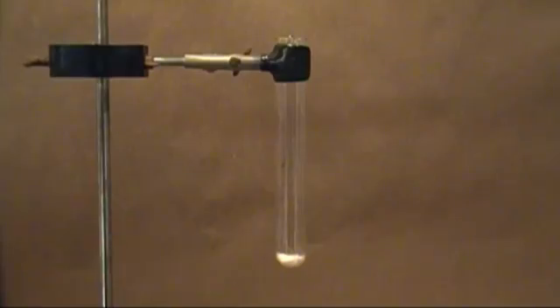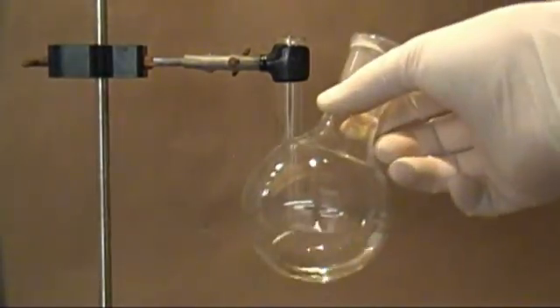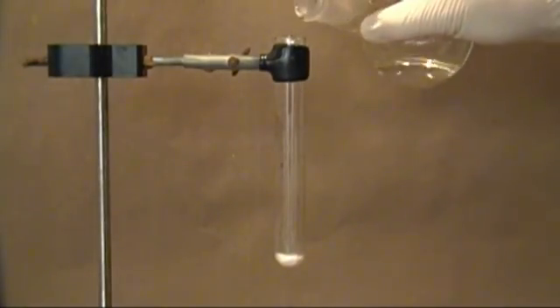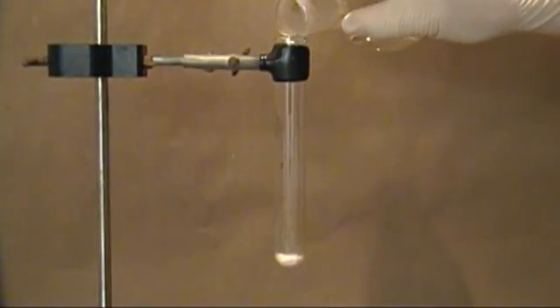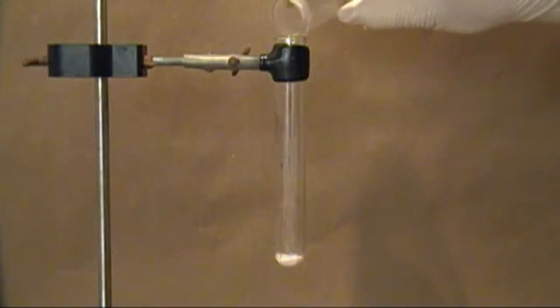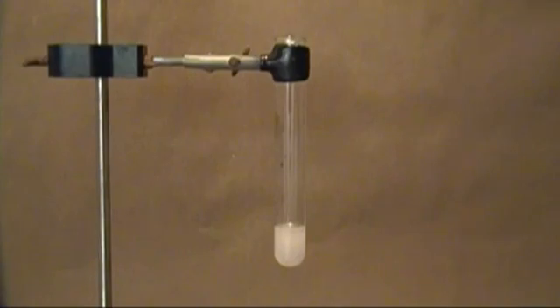The easiest way to test acetic acid concentration is to react it with baking soda. If there's little to no reaction, you have a very concentrated acid. If you get a strong reaction, you have a weak solution. I'm pretty sure this is concentrated just by the smell.